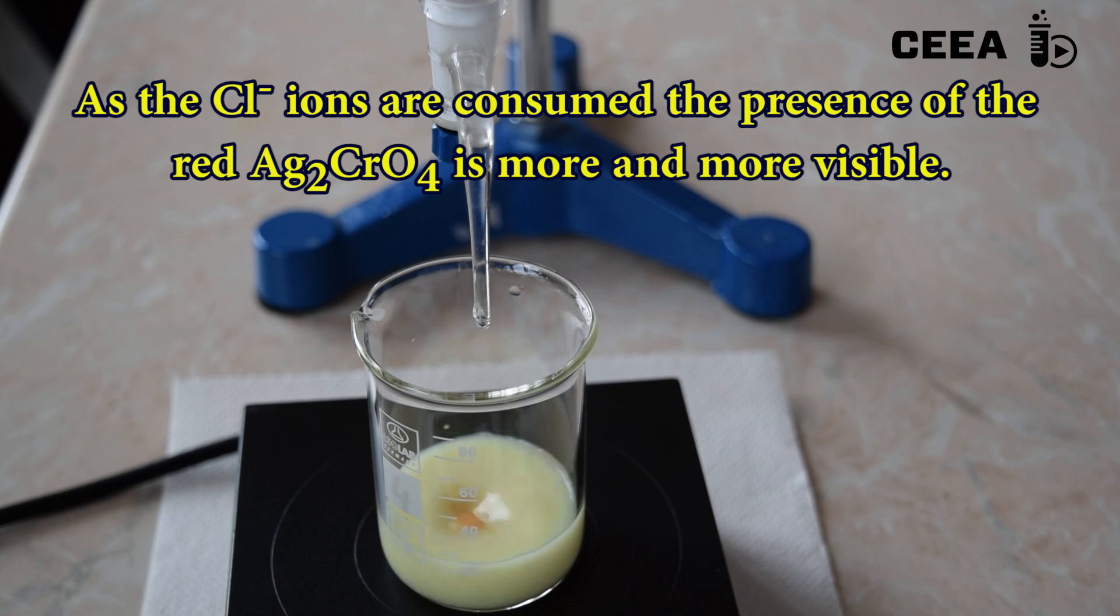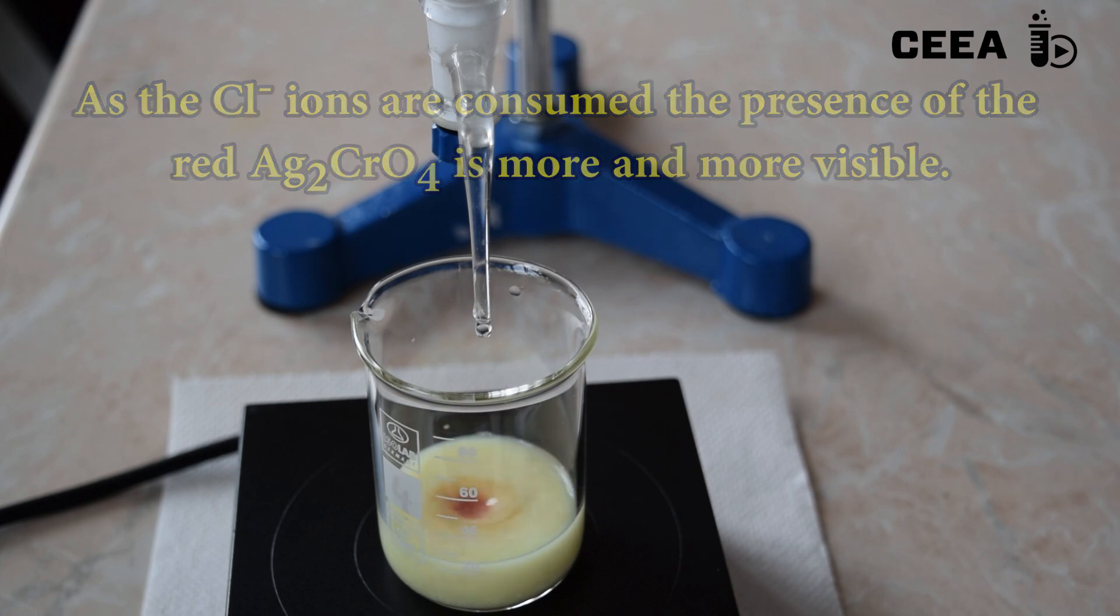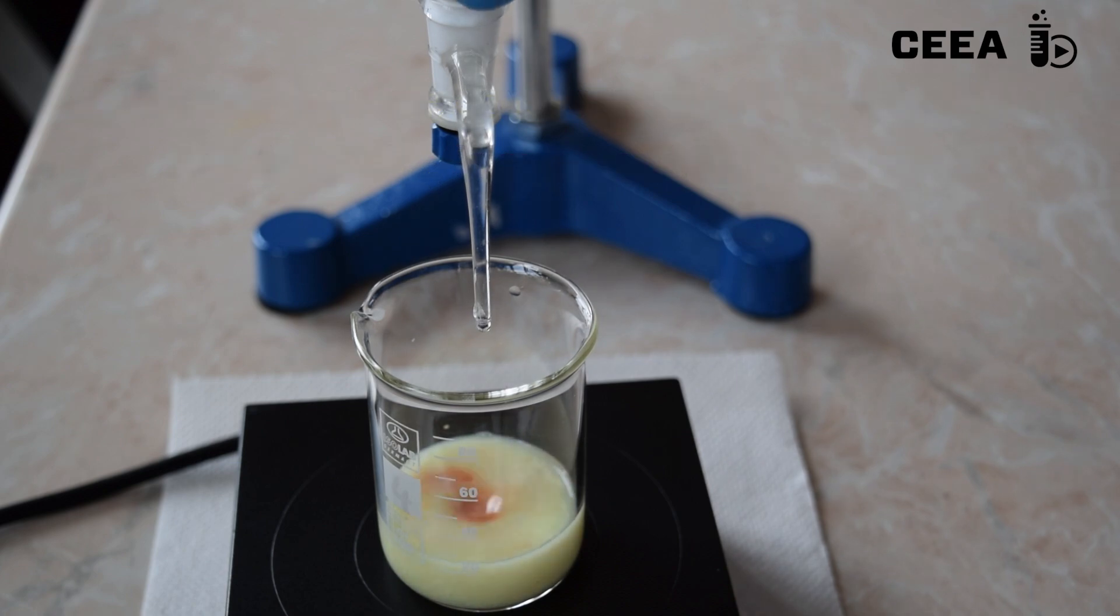Close to the end point of the titration, the addition of one drop of titrant causes the mixture to become red, but the color disappears.